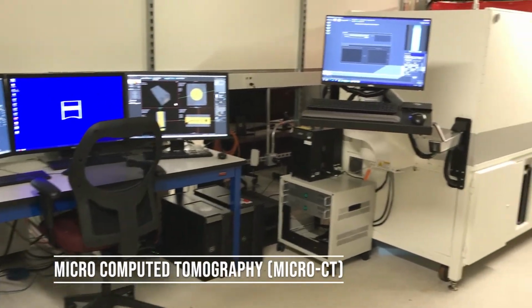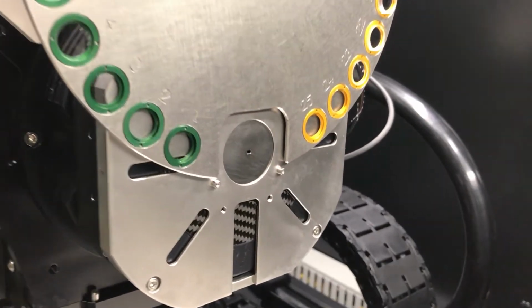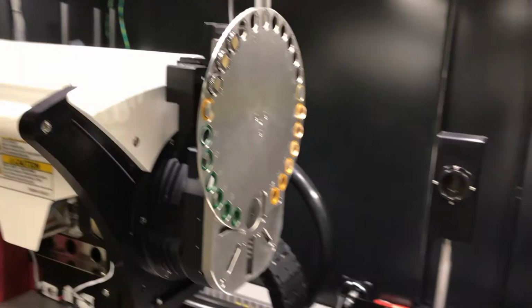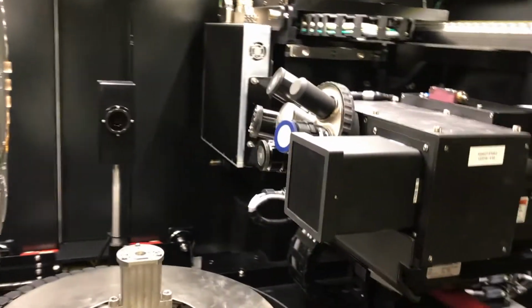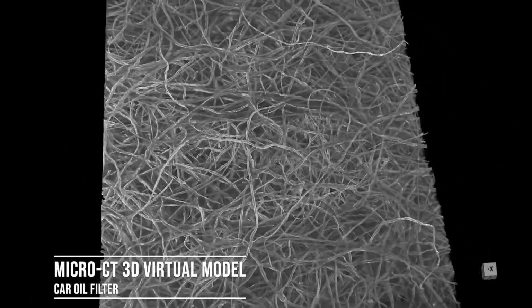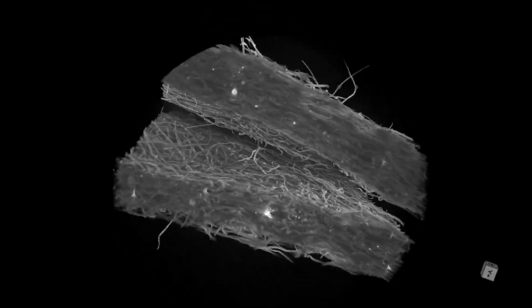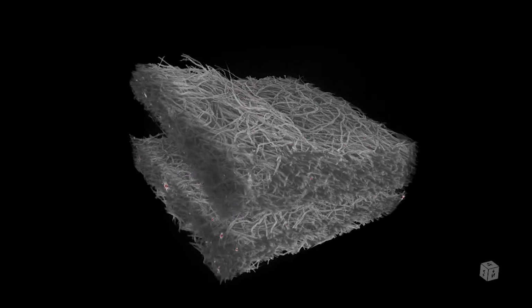Micro-CT, also known as X-ray microtomography, is used to generate 3D renderings of physical objects. We can produce virtual models with a spatial resolution of up to 500 nanometers. Big advantages of this technique are that it is non-destructive and can be used on a diverse range of specimens.